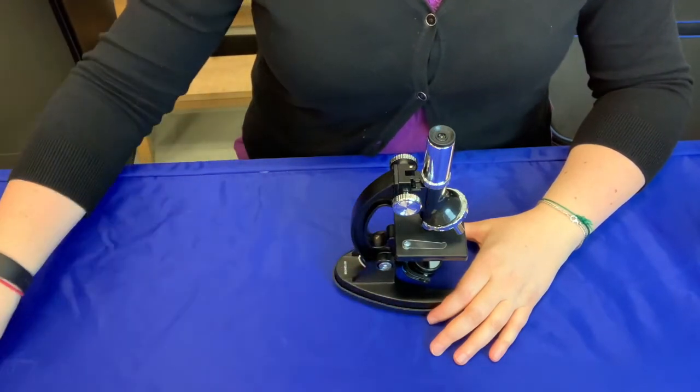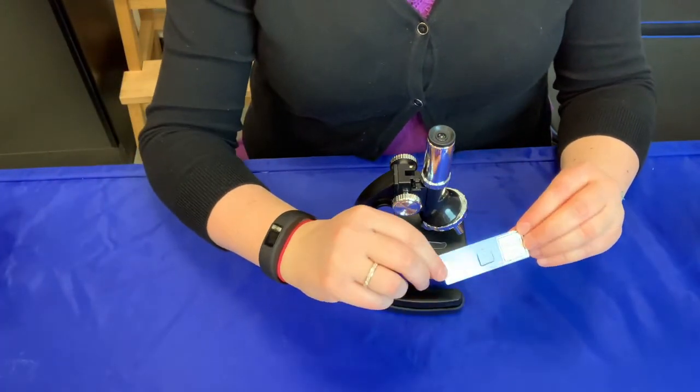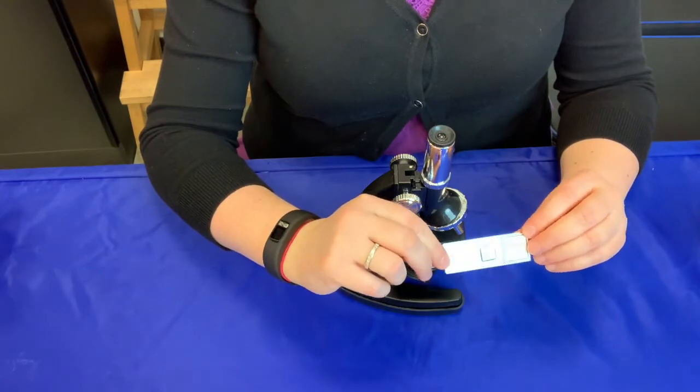The slides for this microscope are made of glass and they may break if they're not handled carefully.